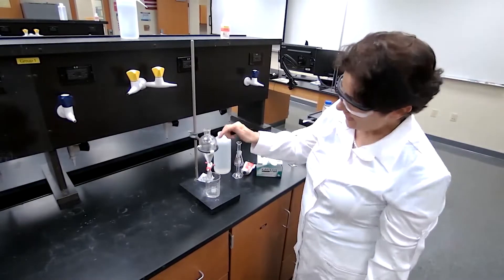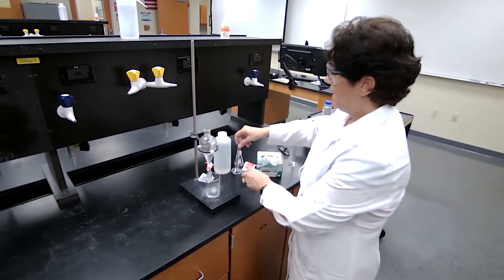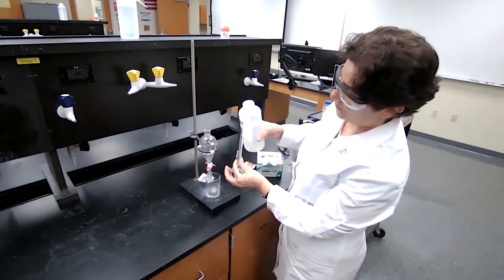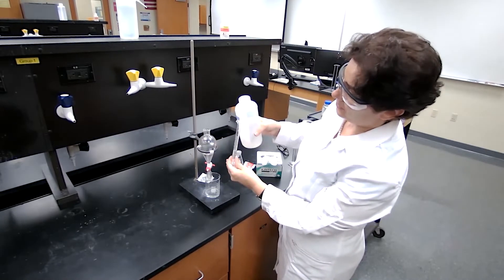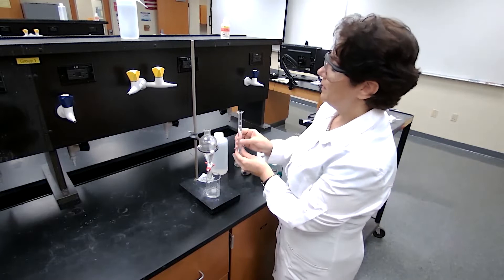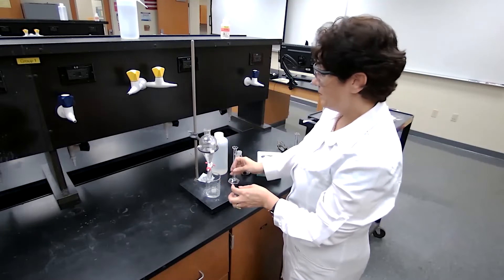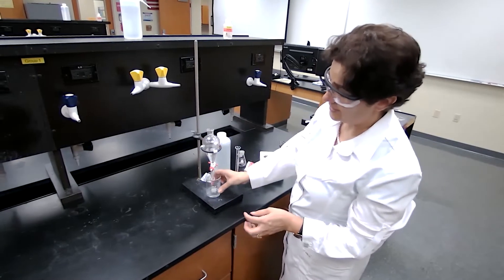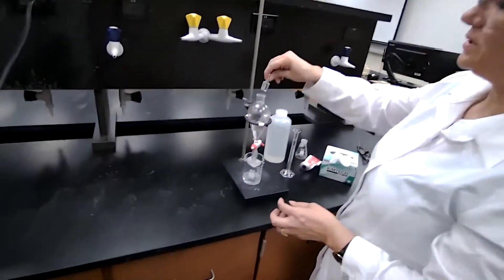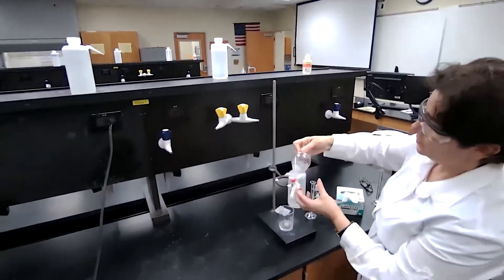To make sure there is no leftover sodium hydroxide in the organic layer, I'm going to use 10 milliliters of distilled water and wash the organic layer with it. This will remove any leftover sodium hydroxide. I'm going to combine this washing solution with the same container holding the two portions of sodium hydroxide solution.